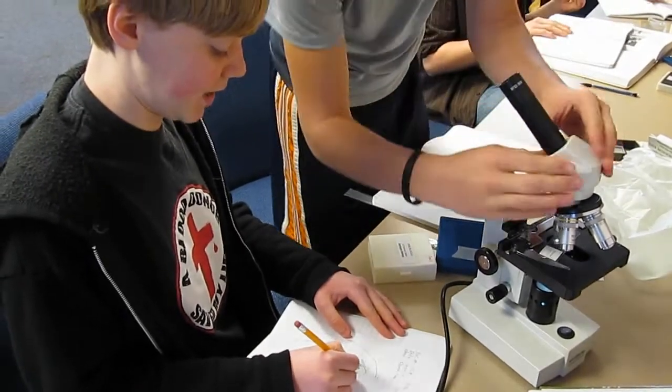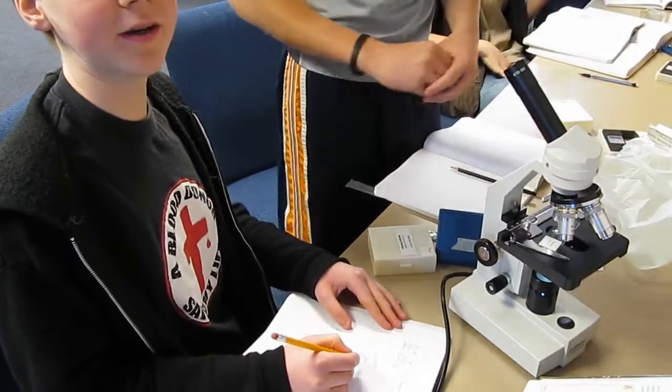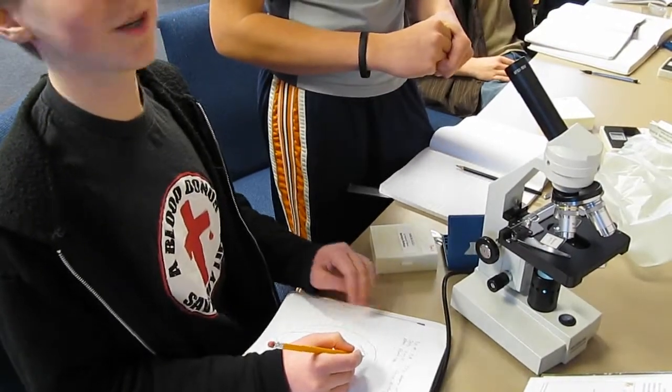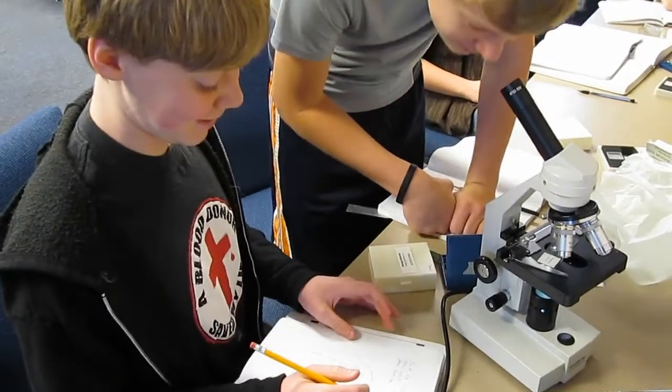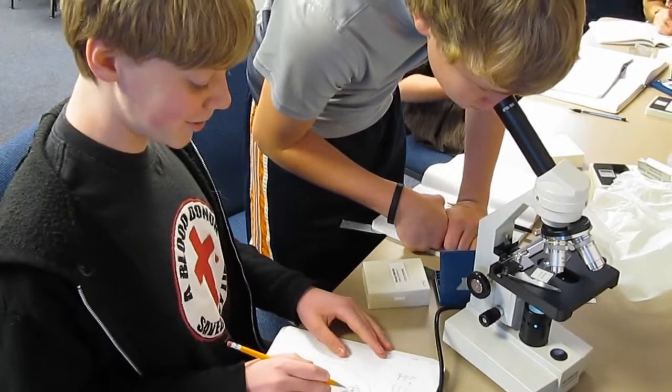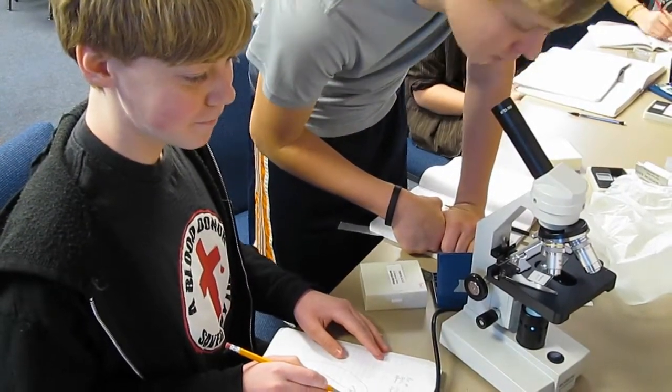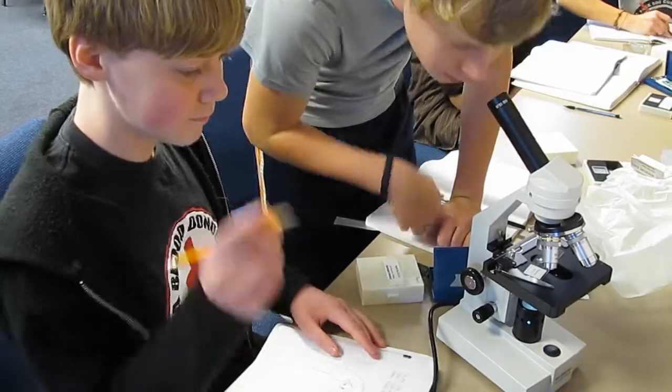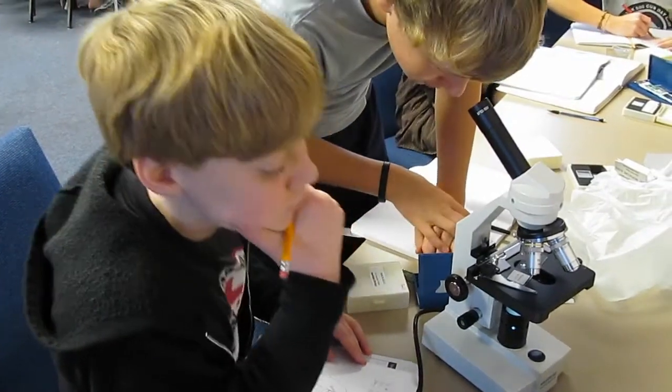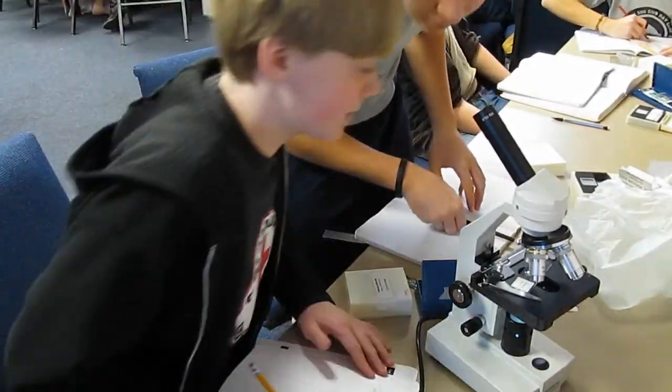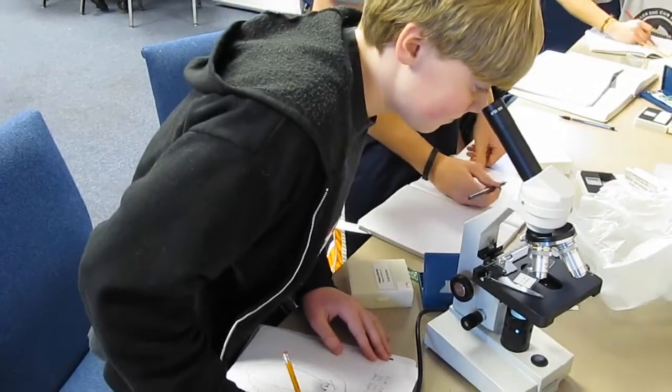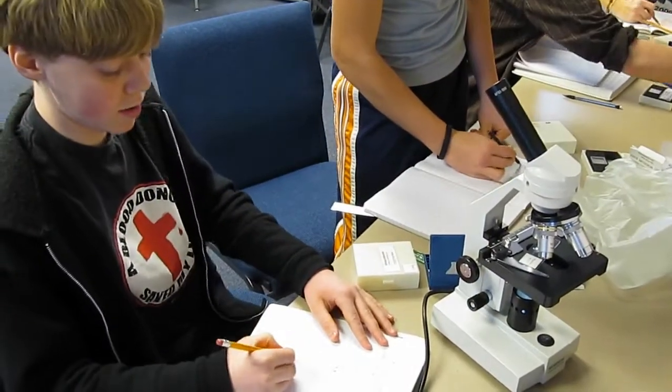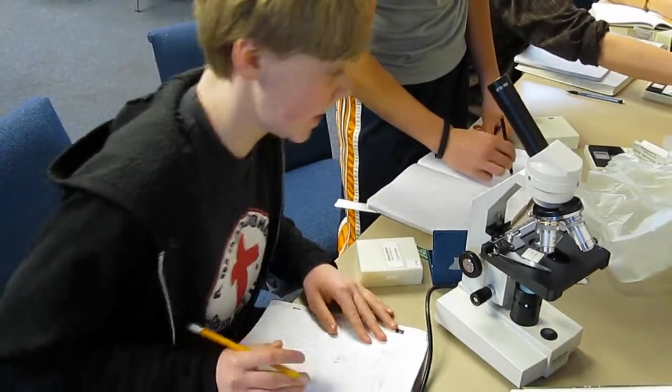I think she's taking a video. You don't want to say that? You're not taking a video? No. Good, that was close. That would have been really bad. Hey, the arrow looks like a smiley face. What's supposed to do today? There's like this big yellow thing there. Do we have branched intestines? Maybe. Yeah, oh yeah we do, we have branched intestines.